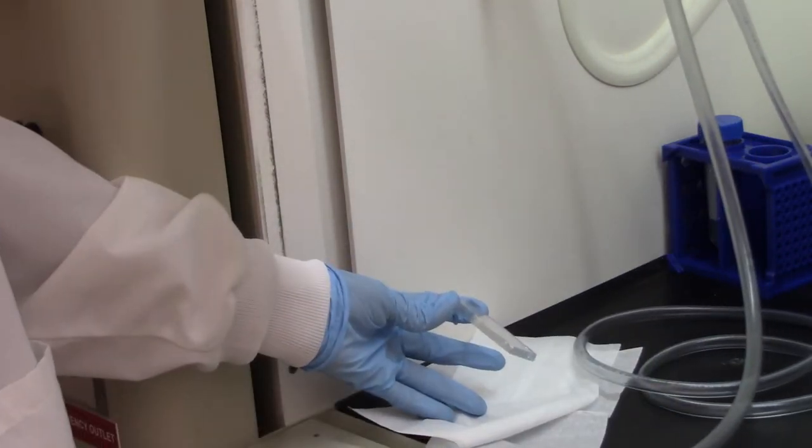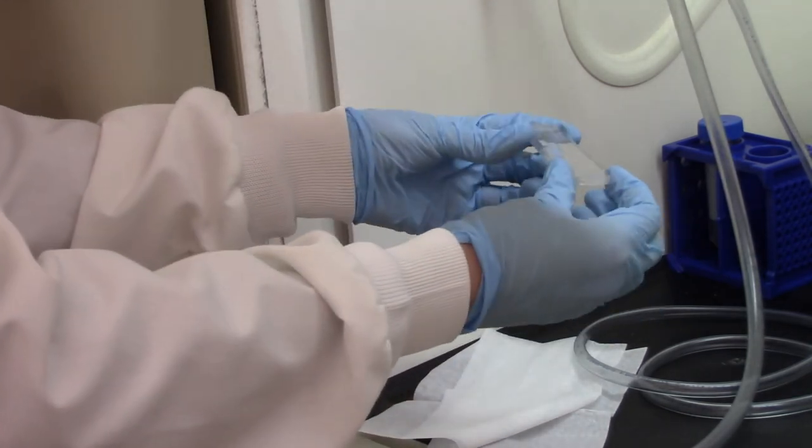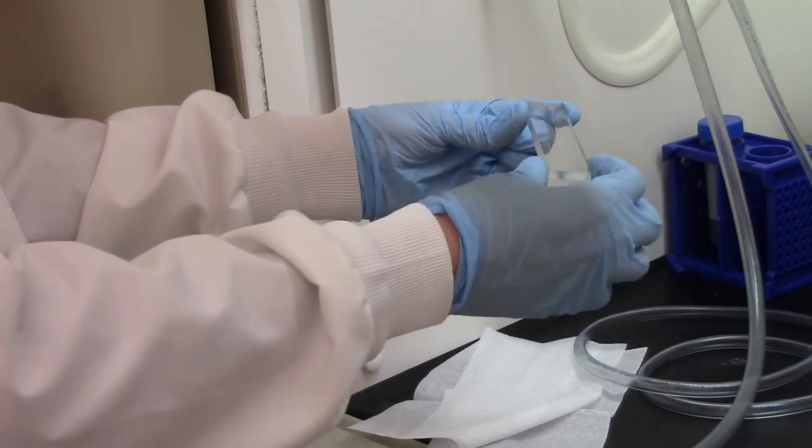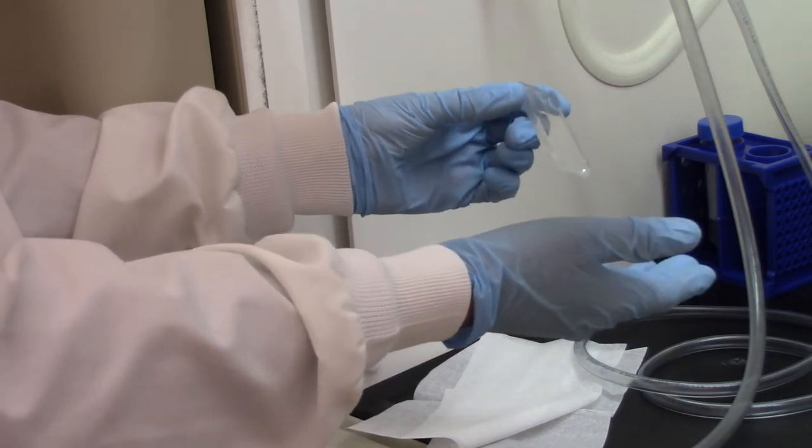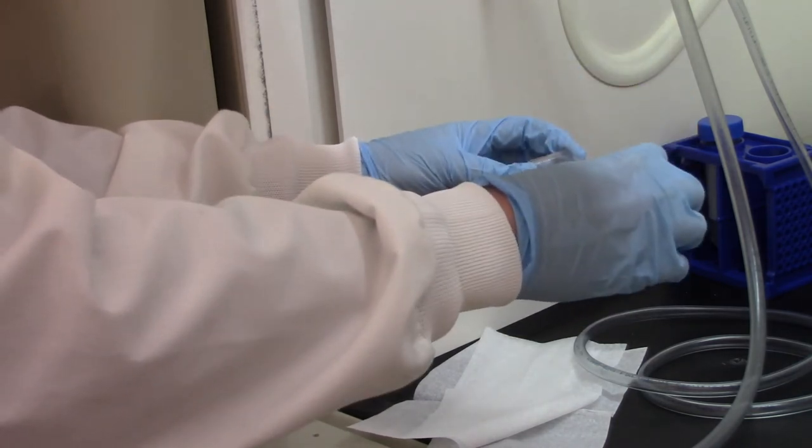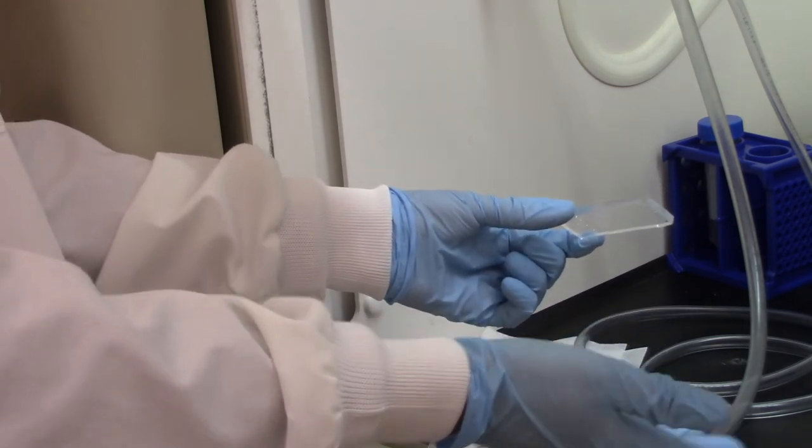Okay. I'm going to turn off the nitrogen. And then what we do next is we check which side has the shape embedded in the PDMS, so which side has your microfluidic channels. And then we'll put that feature where we say it's feature side up in a clean Petri dish until our glass slide is done on the hot plate.